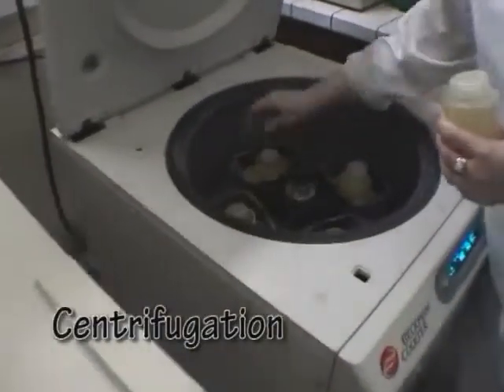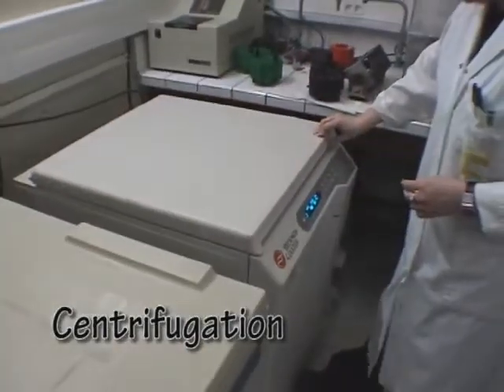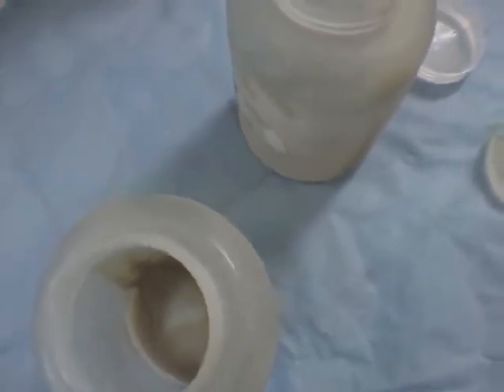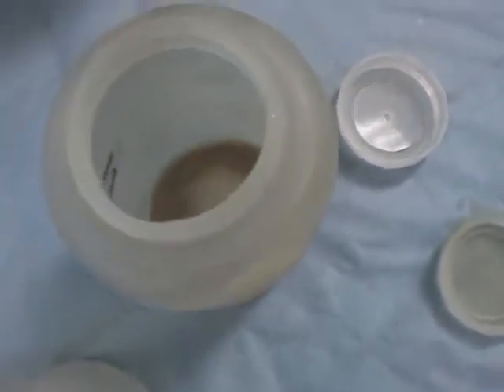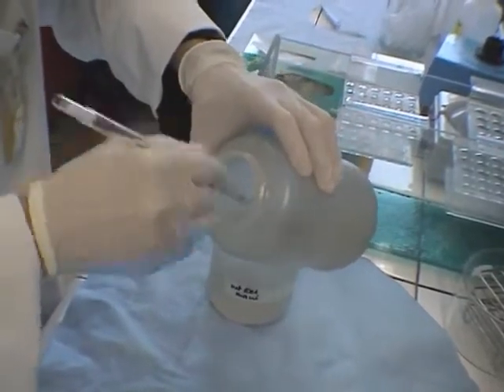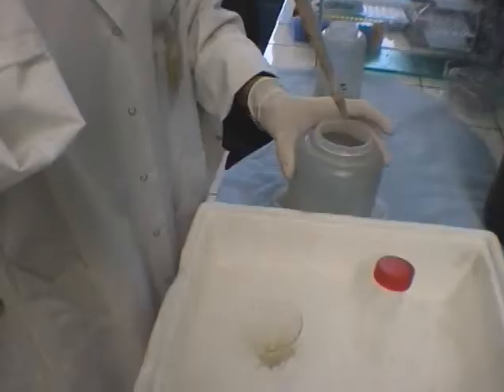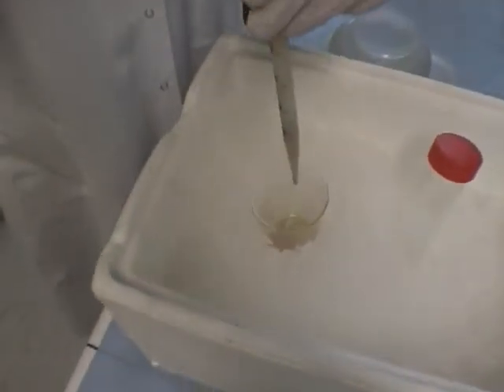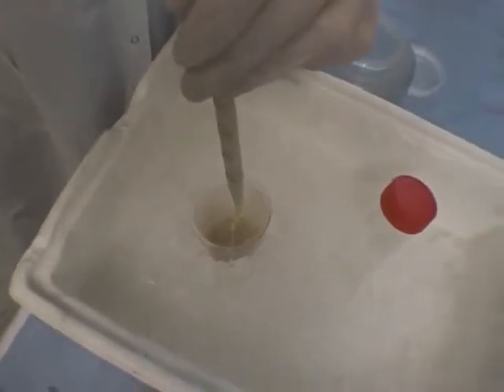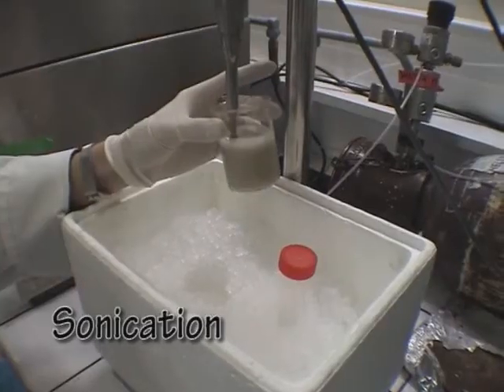The cells are separated from their food and waste products by centrifugation. This pellet of cells is resuspended in a cold, clean solution, and the cells are broken by applying ultrasonic pulses, thus releasing the molecules that they contain.